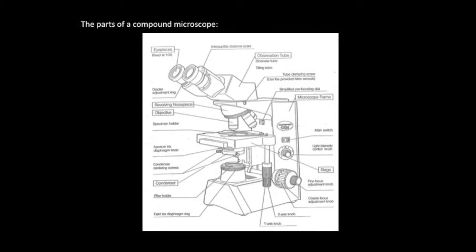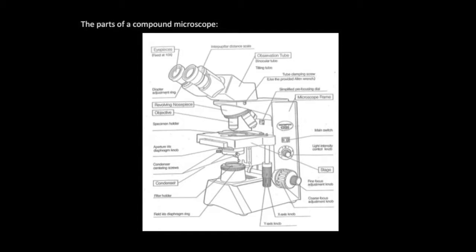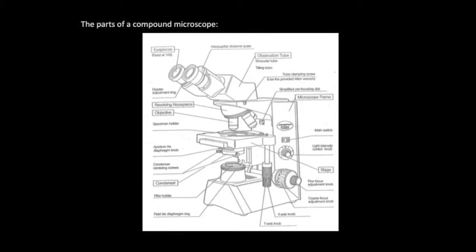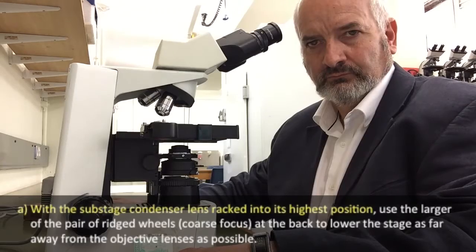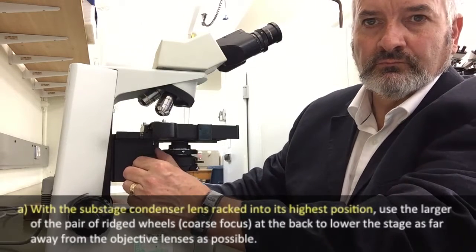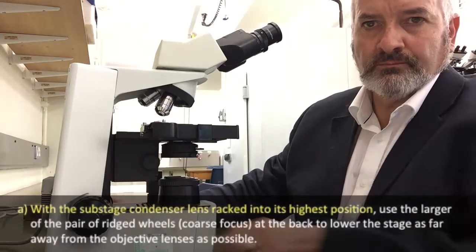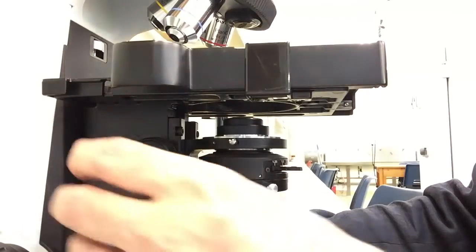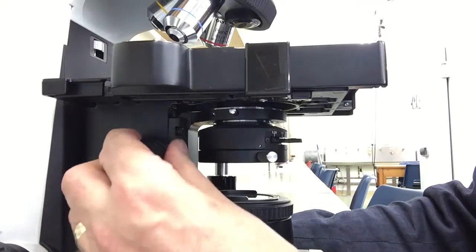It may be useful to consult the labelled diagram of the component parts of a typical compound microscope that's supplied with the handouts for the class and is available also in the online material. The first step in focusing the lens on the specimen is to rack the substage condenser into its highest position. Here's the substage condenser — it's moved by the knob on the left-hand side of the microscope.